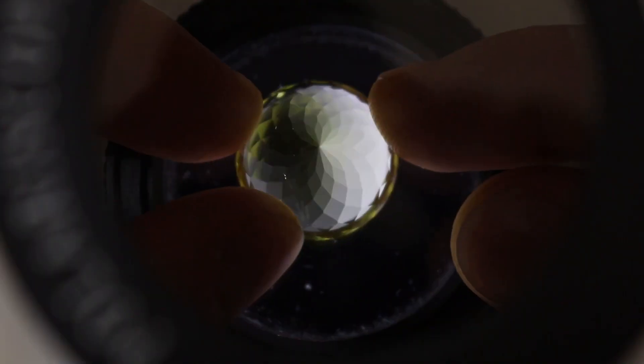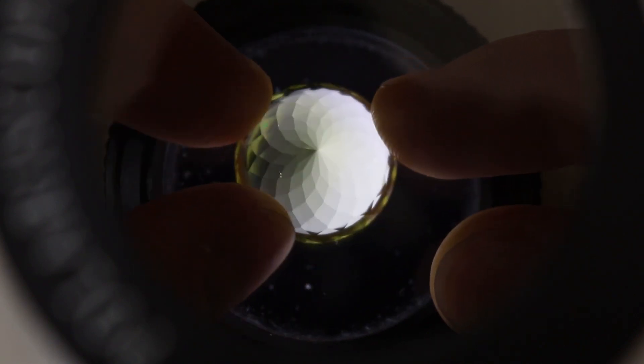It's only remaining in that one direction and it's getting blocked by that top polarizing filter. So this lemon quartz and this tourmaline both split light in one optic axis, so they'll appear to blink. This topaz will also appear to blink, but it has two optic axes. So how is it different? How are we going to know?